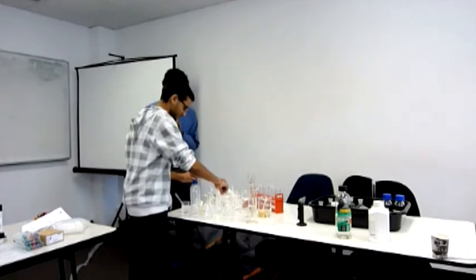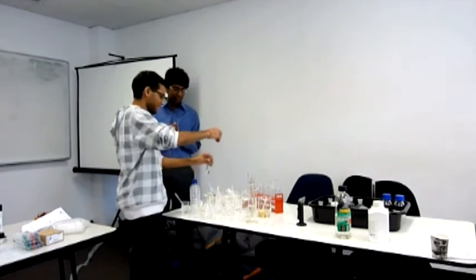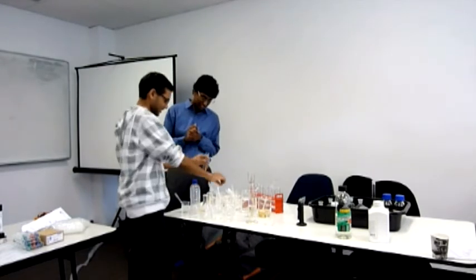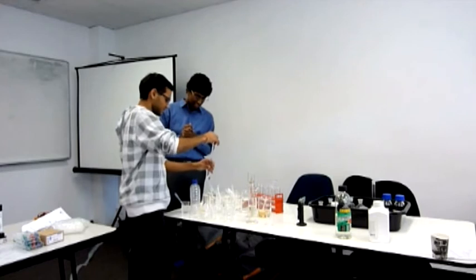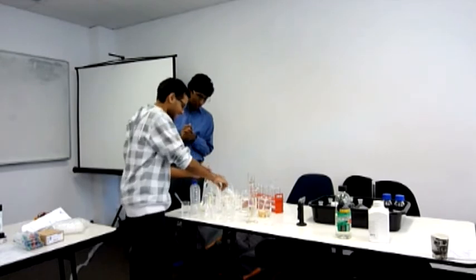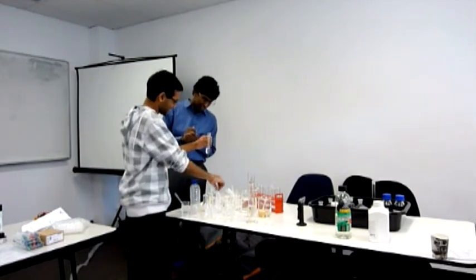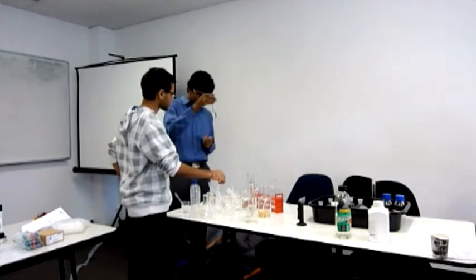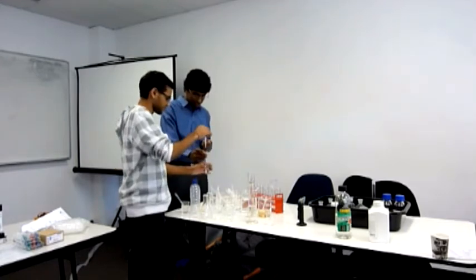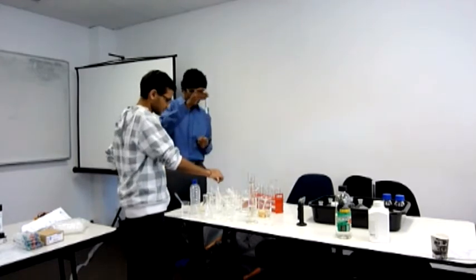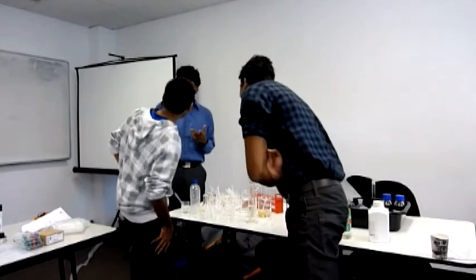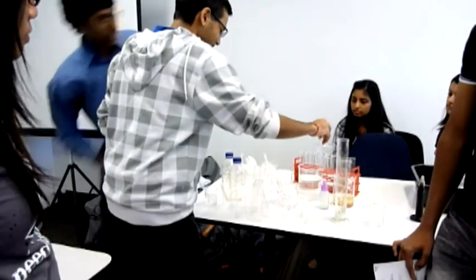Add more. We added in excess, yes. Are we seeing anything yet? No. Now it'll start separating out. Can you see something? I can see it. Do you want us to see it? There you go.